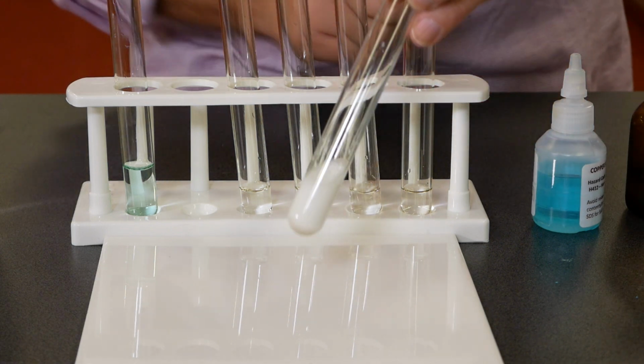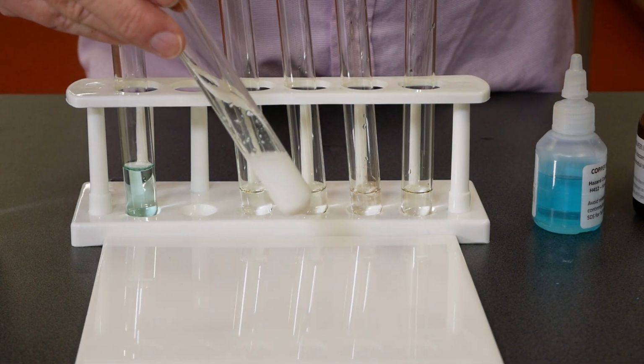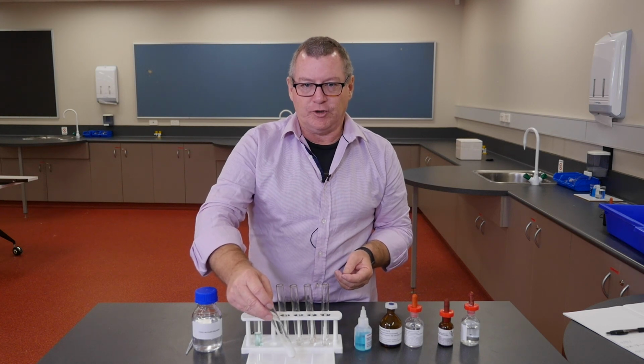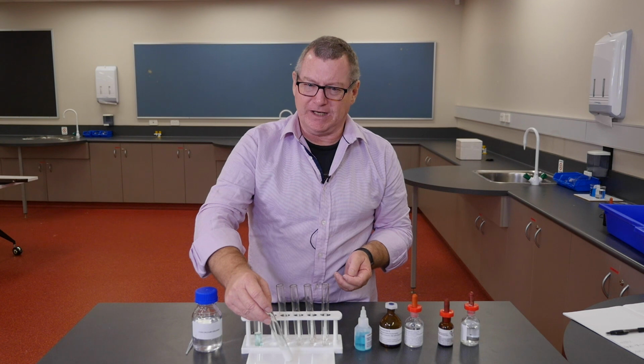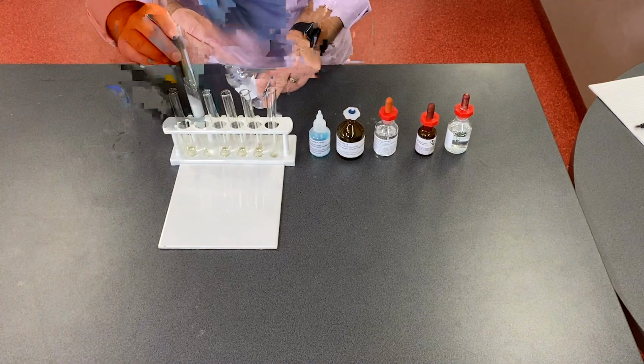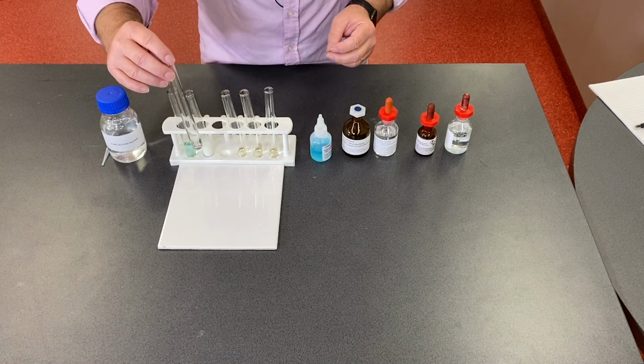And in fact, silver nitrate is a test for chlorine in drinking water. If you want to know whether there's much chlorine in the water you're drinking, dropping some silver nitrate in as a test is a good test. Don't drink the water after it's got silver nitrate in it. So we've got that silver chloride precipitate from the silver nitrate.